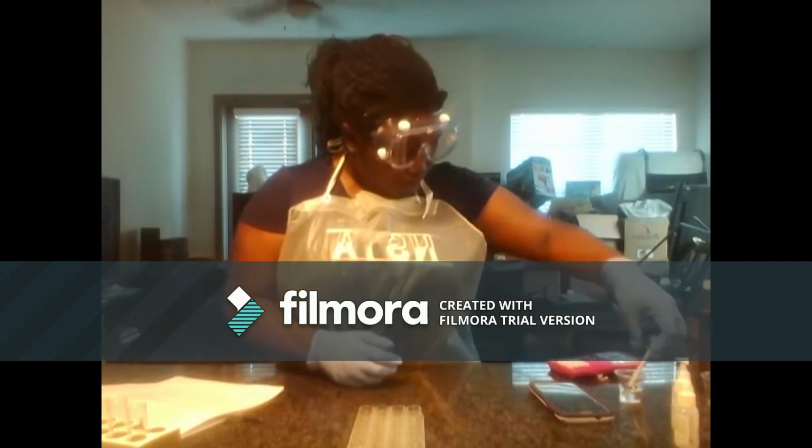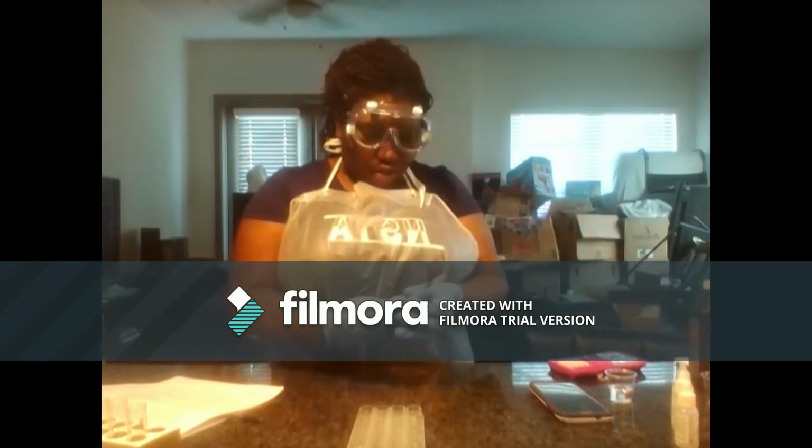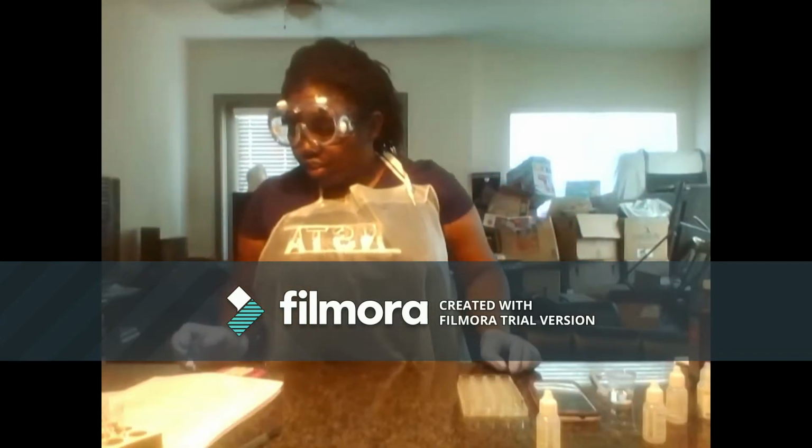And have drawn up 0.4 mLs of hydrogen peroxide. Alright, so we can move on to trial 3.